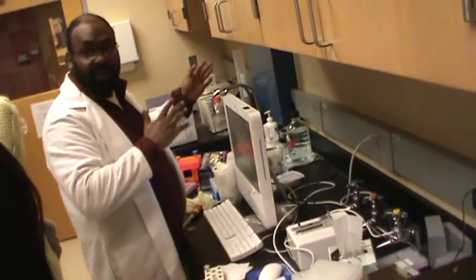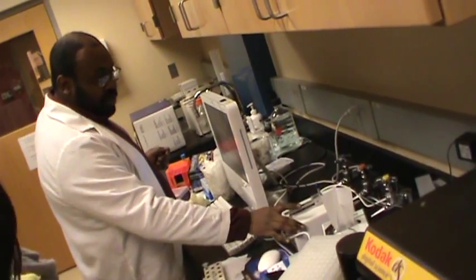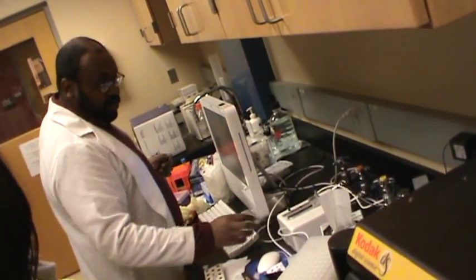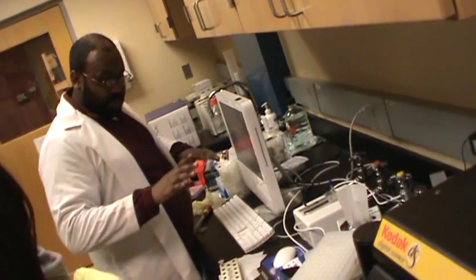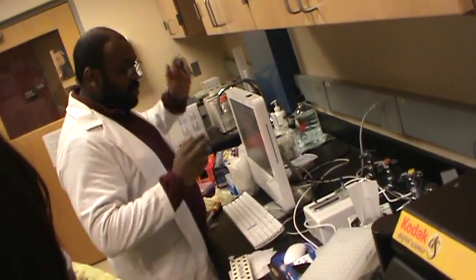But if you go on YouTube and type nanodrop, they give you a whole detailed video.